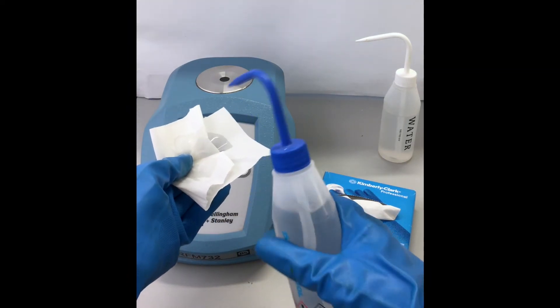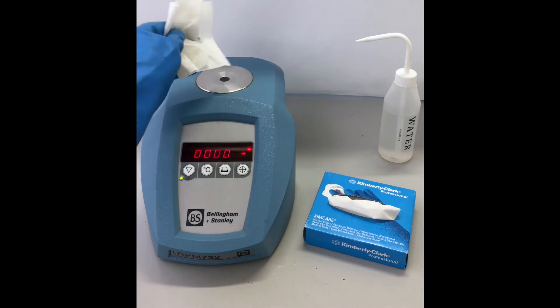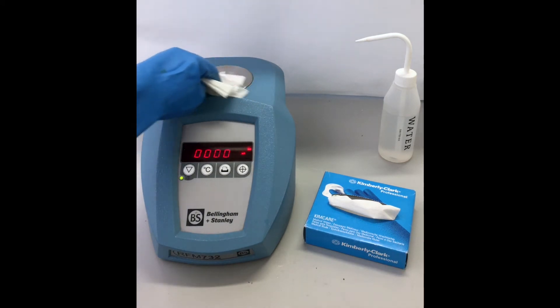Using isopropanol and tissues, clean the measuring prism and the prism plate before and after every measurement.